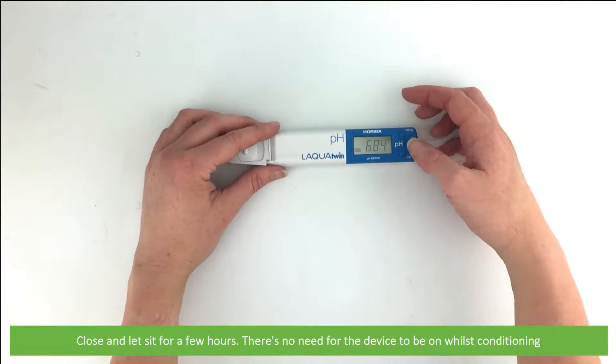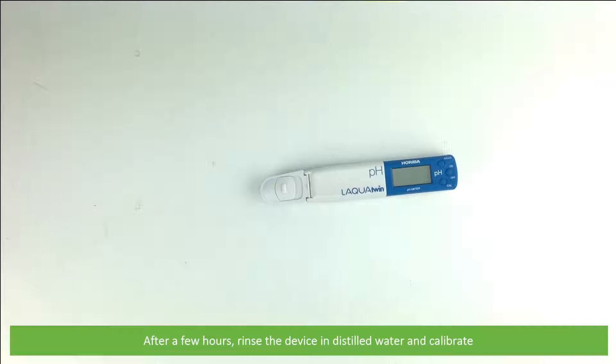After a few hours, rinse the device in distilled water and calibrate.